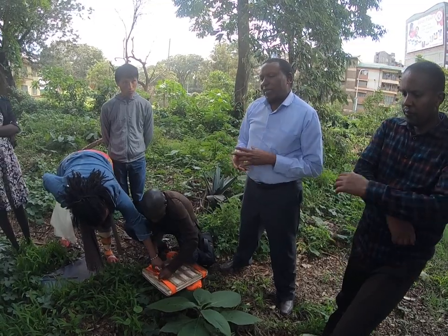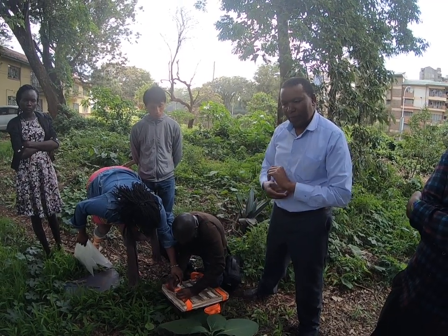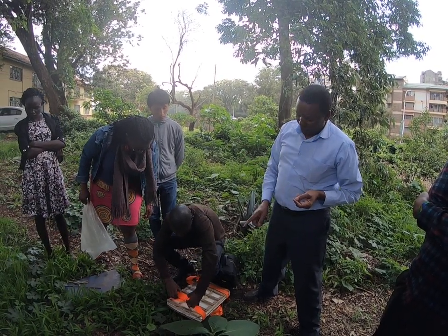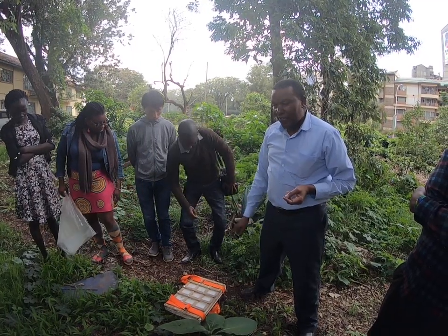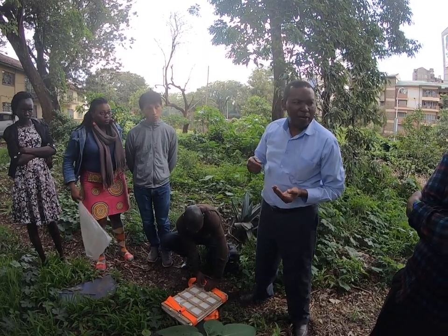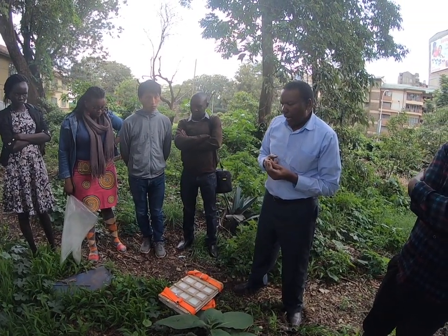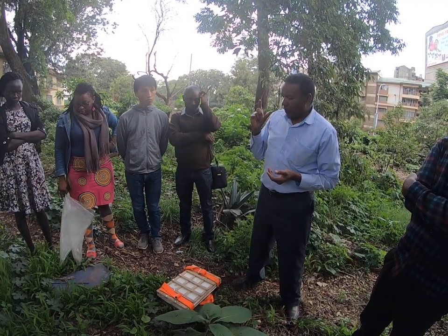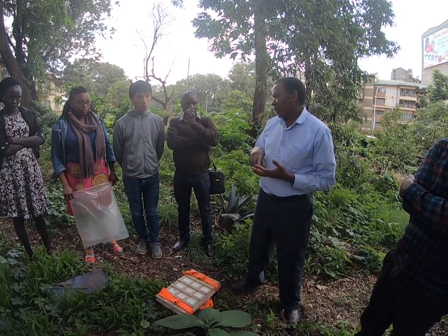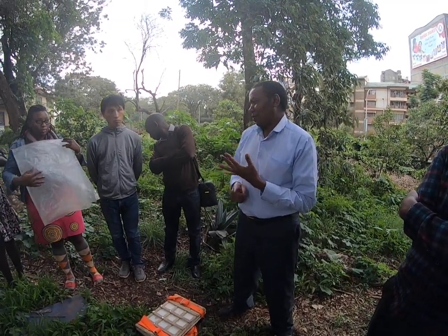And what do you put in the plant specimen? That is important. Because the purpose of carrying a plant specimen is identification, you need to carry a specimen which somebody in the herbarium will be able to identify or to help identify the plant. And the most important part which helps the herbarium person identify is actually the flower. Let's take note of that. The flowers and the fruit.